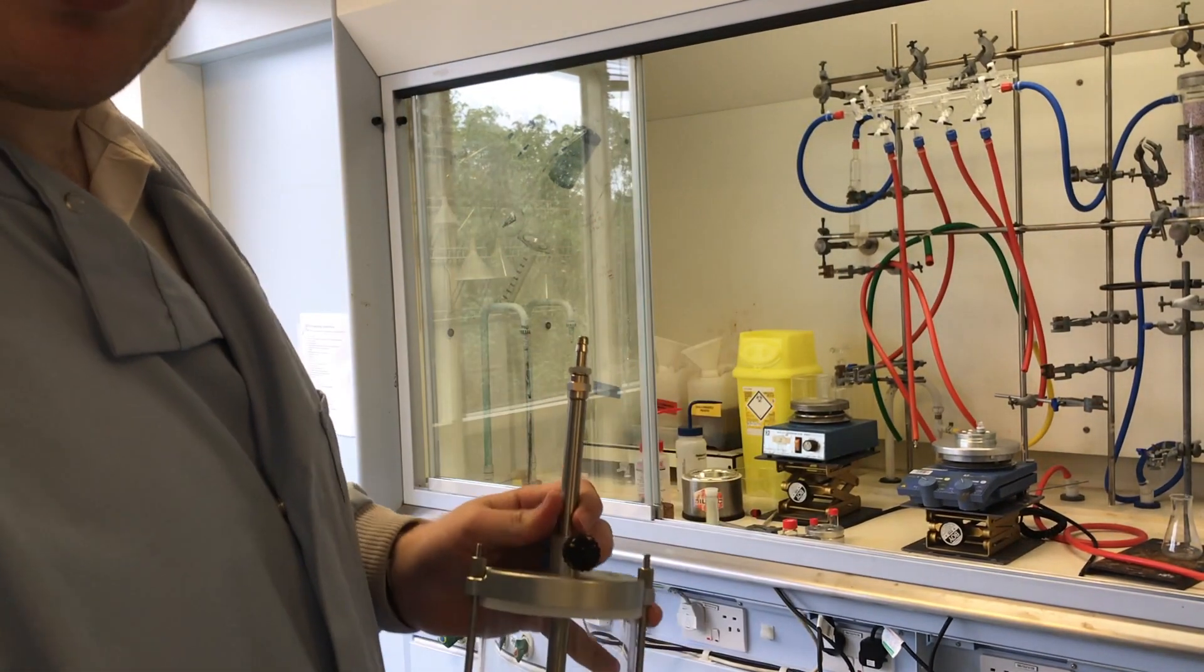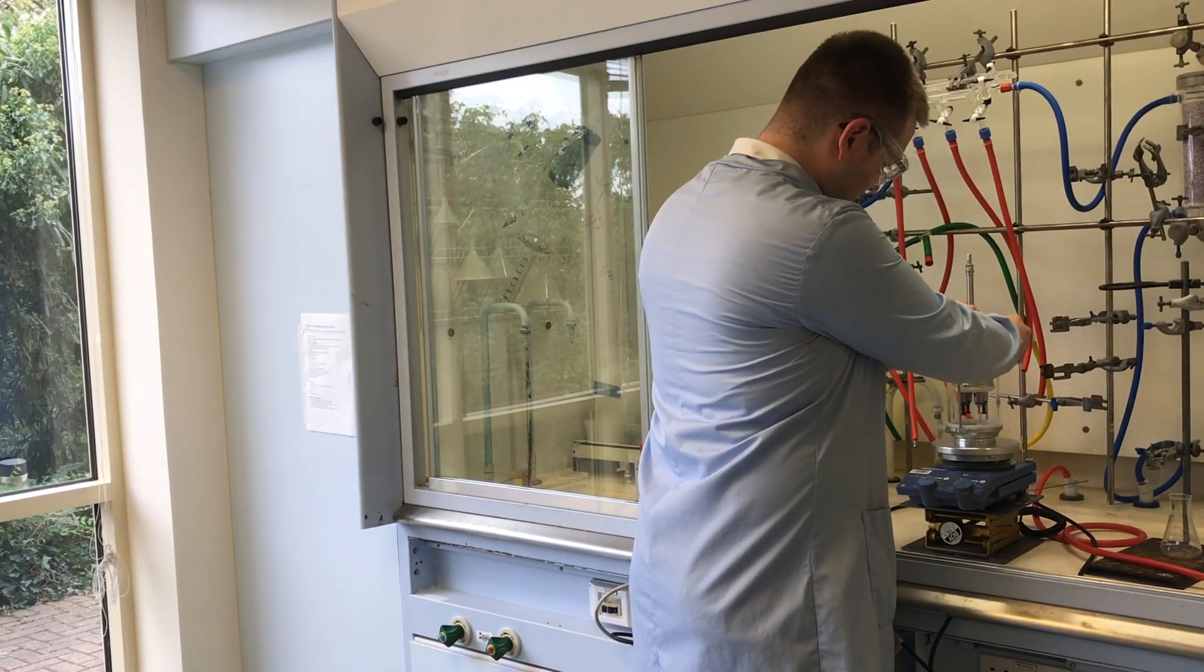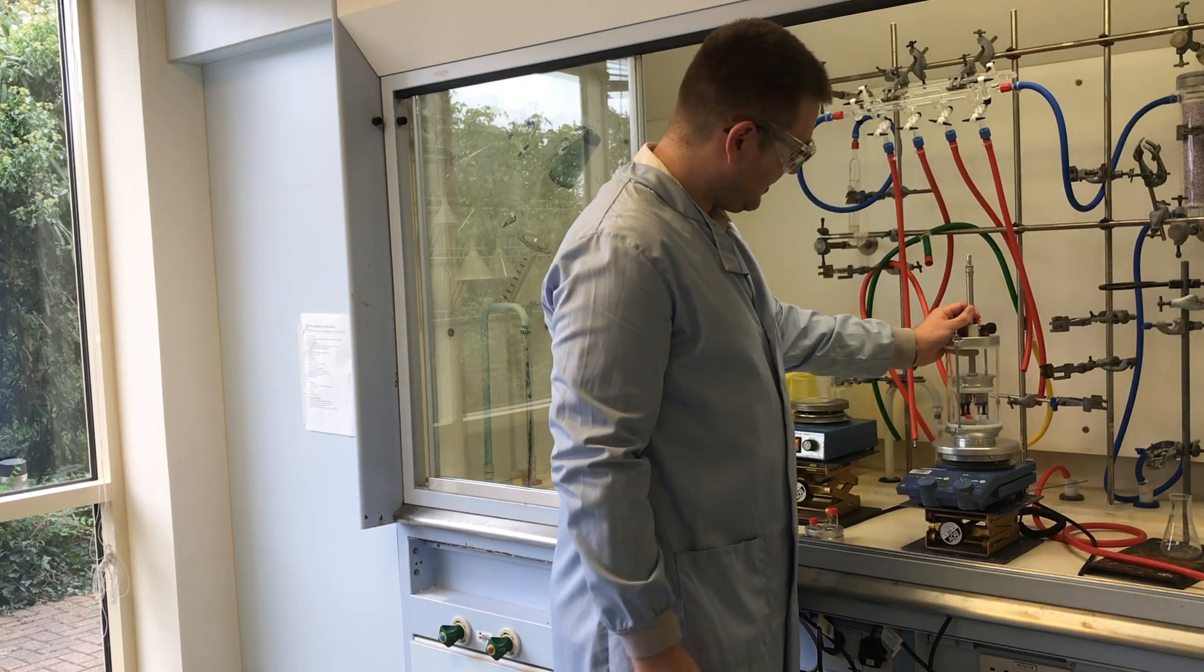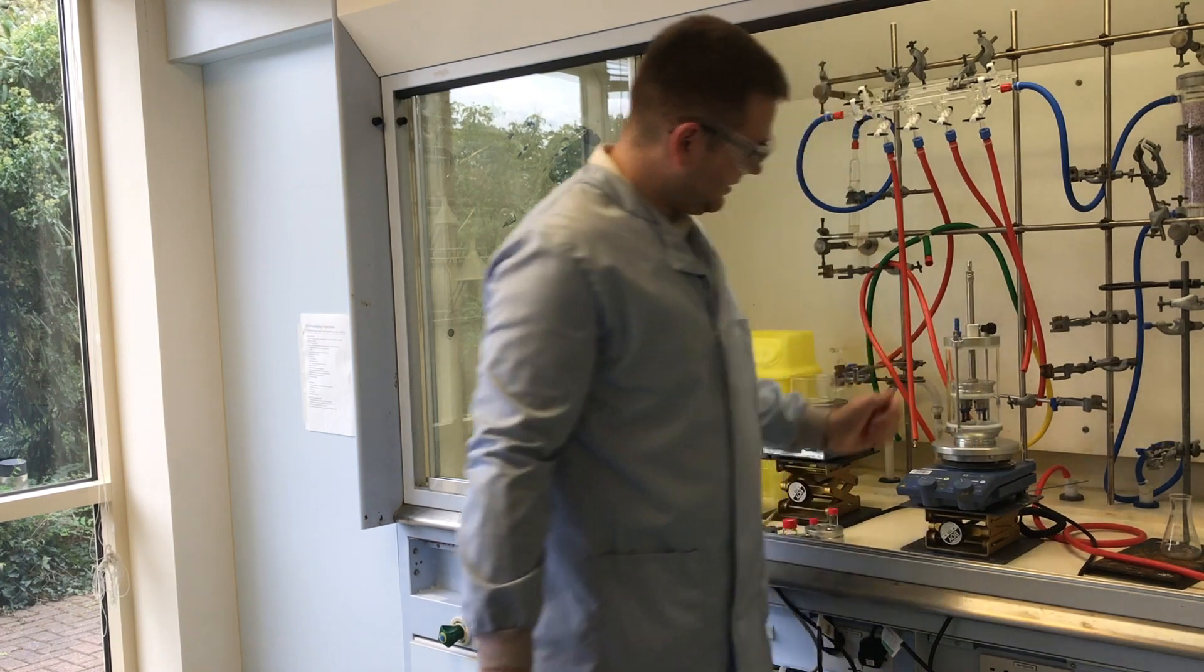Just take it over to your sample, sit it on top, pop it down, and tighten it up.